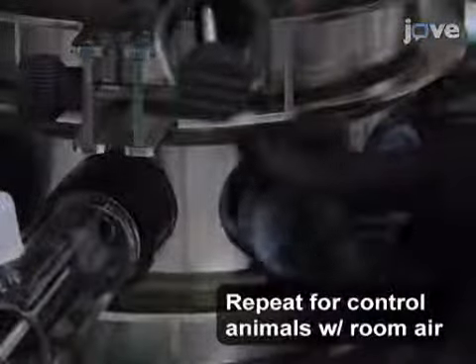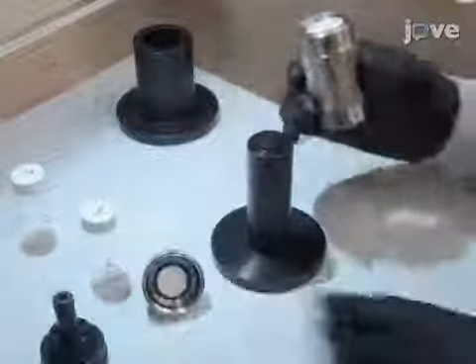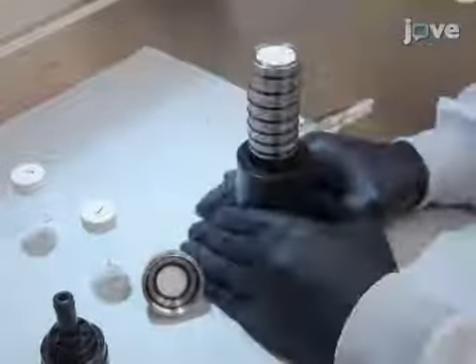When all of the exposures are complete, turn off the aerosol generator and remove the mice from the inhalation unit. Then collect the cascade impactor and absolute filters for analysis.